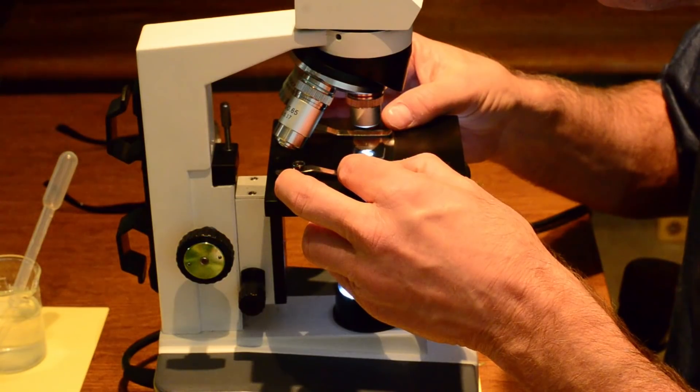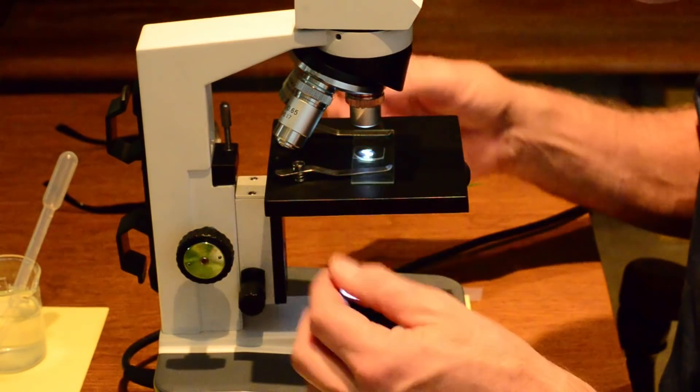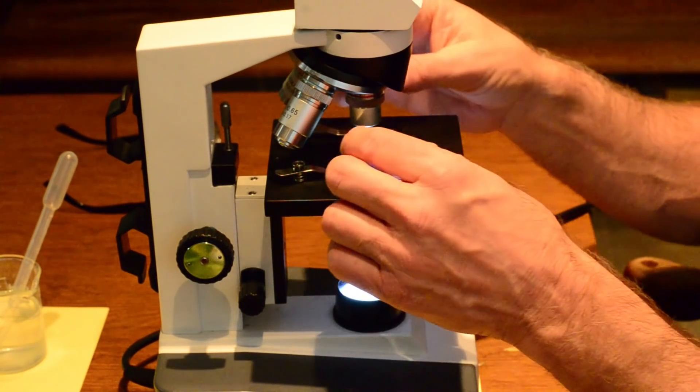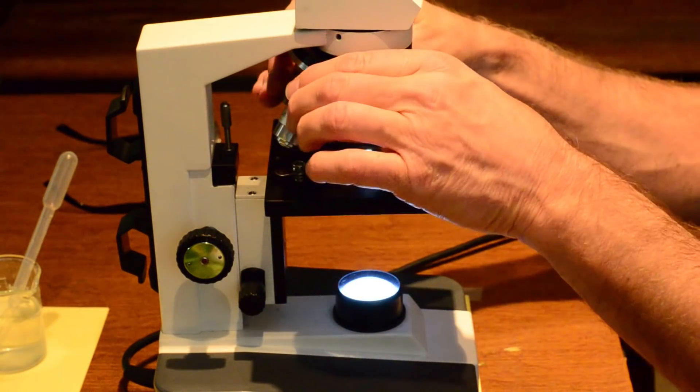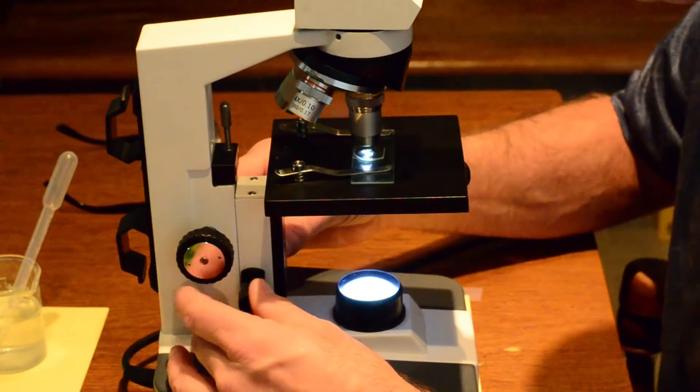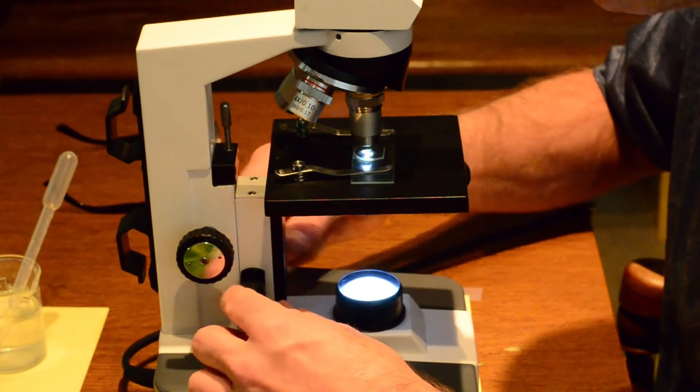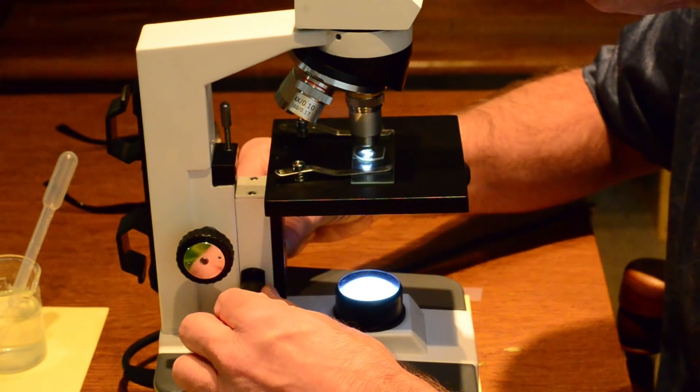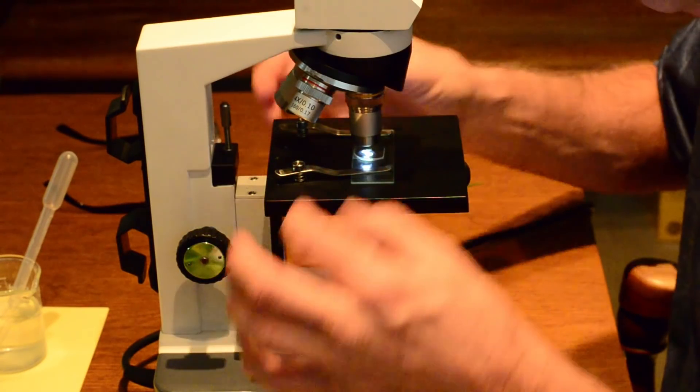I'm going to go in a little closer. I like the low power for this because they're so big. I'm going to medium. So I'm going to switch to my yellow. And it's right there where I need it. So I'm going to use my fine adjustment and just go back and forth just a little bit until it's in view. Nicely done.